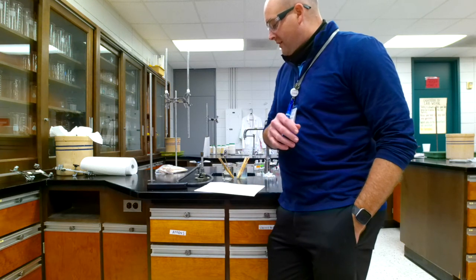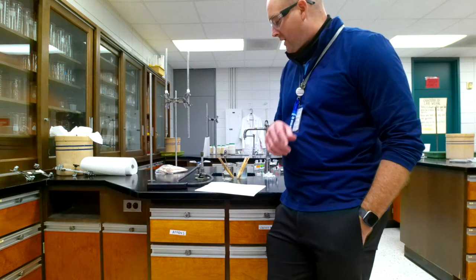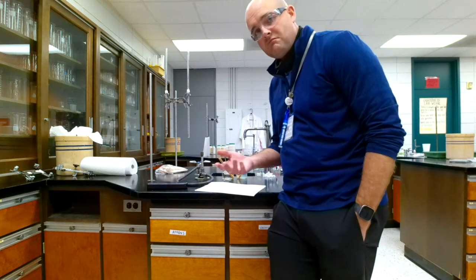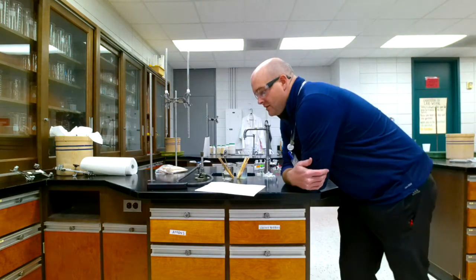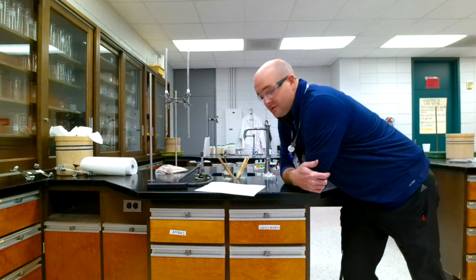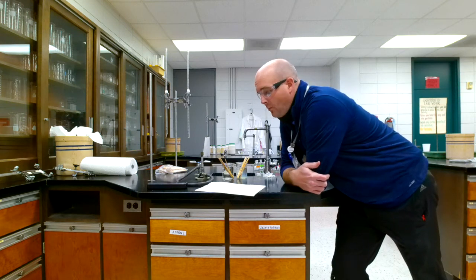Assuming only the metallic ions used in this lab, if a flame test produces a red flame, what ions are possibly present? I bet you could figure that one out. How could you distinguish between the ions that produced a red flame? What ions could be eliminated as possible ions if the flame test is red?